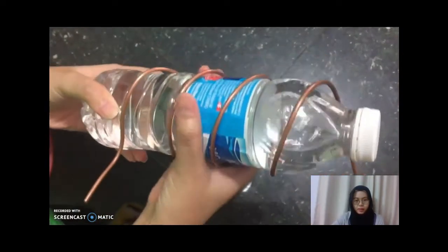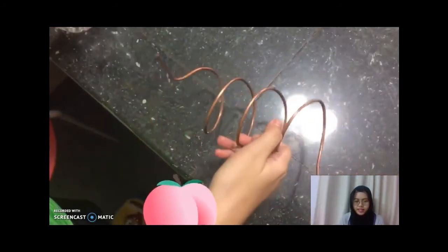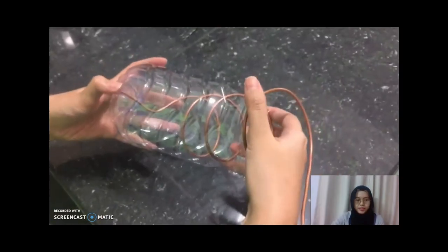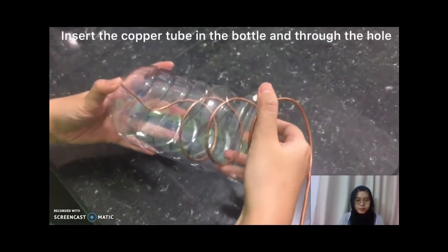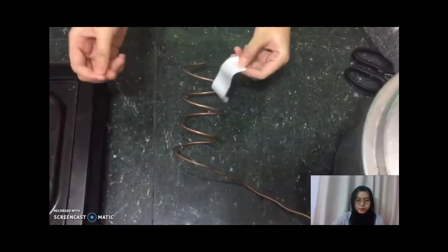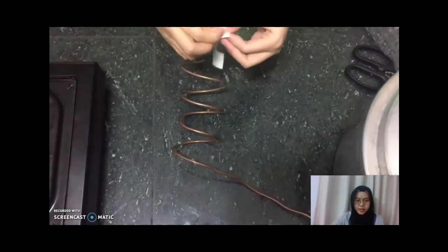Then coil the copper tube around the smaller bottle to make sure that it fits inside our condenser. Then insert the copper tube into the condenser through the hole. This is the silicone tape.